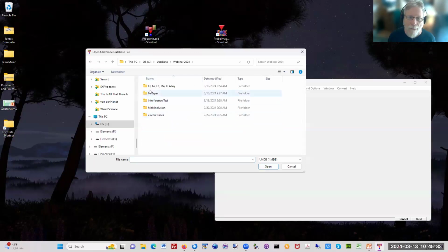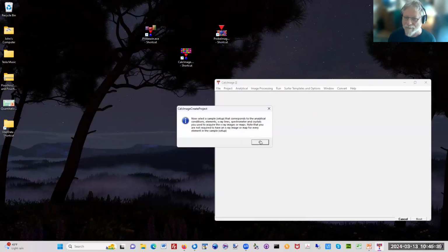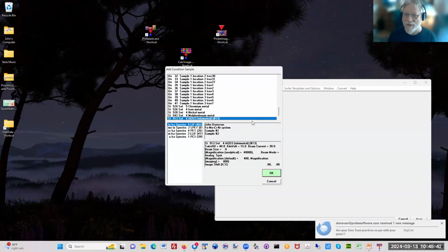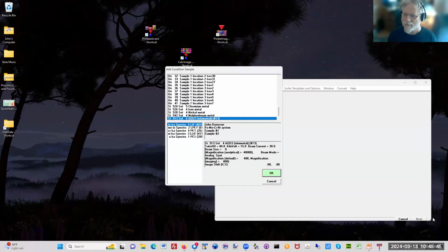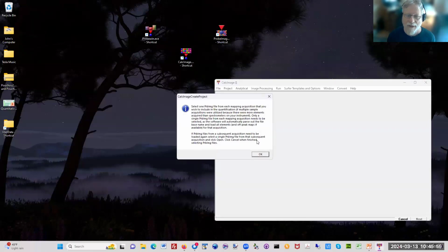And so I'm going to go here, and here's a map that I'm going to load in. And now it says select the sample setup. So this is the same setup you use for the standardization in Probe for EPMA that you're using for your maps. And it could be the last unknown. If you use quick standards, they might not have all the elements there, but in this case, we ran the same elements on the standards as on the unknowns, so it doesn't really matter what I pick. So I'll just pick that, and it says select one map file from each mapping acquisition. So I could pick one map per 5 elements, the first 5 elements, and maybe the next 5 elements, the next 5 elements, so that way you can do n numbers of maps and quantify them all at once.